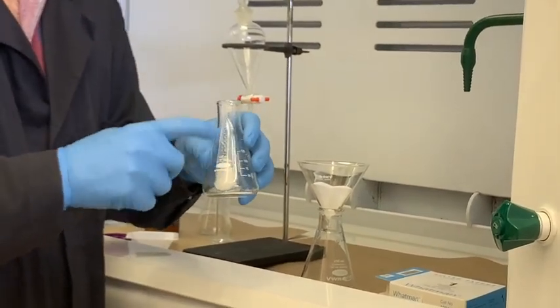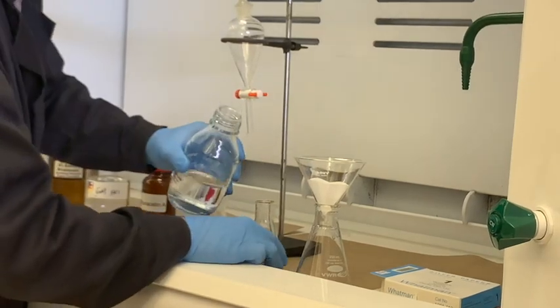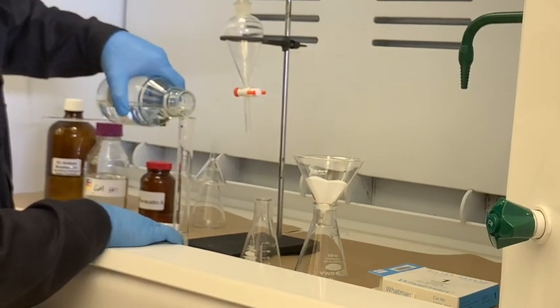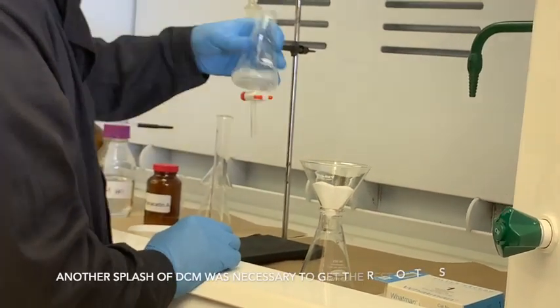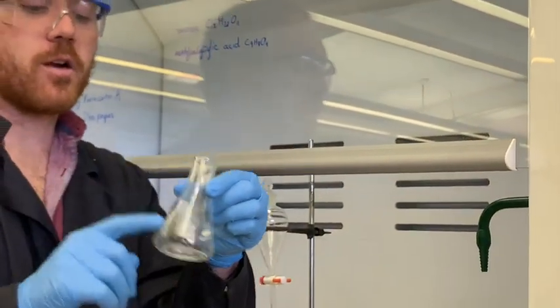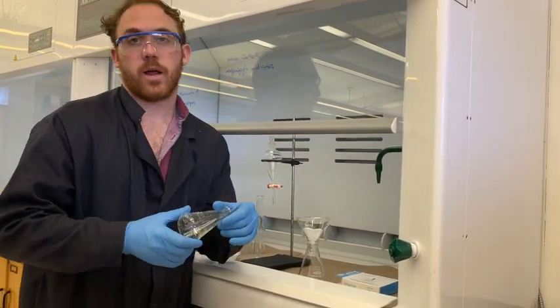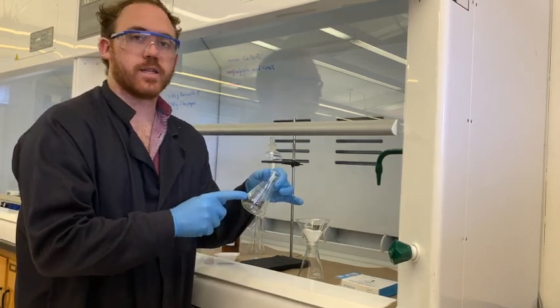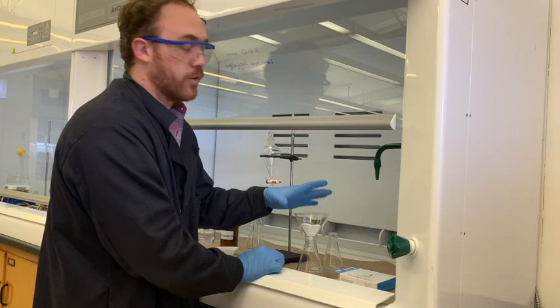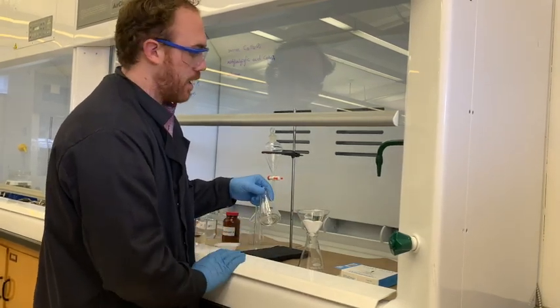We have all of the sugar right here, and that's quite a bit. We want to keep as much as we can, so I'm going to add another 20 milliliters of DCM. There's still a bit of sugar — one thing you could do is weigh the filter once it dries, then clean it out, weigh it again, and see whatever leftover residue there is if you're trying to figure out the exact mass of sucrose. We'll be fine with an approximation today, and it's good to note that some residue loss is going to happen regardless.